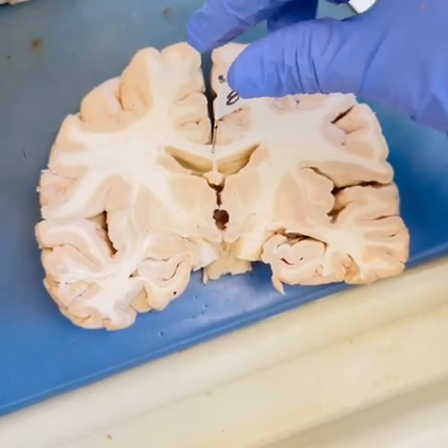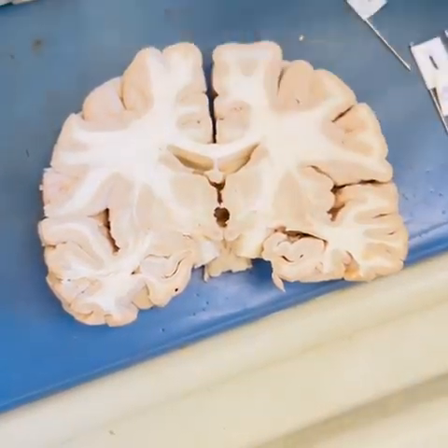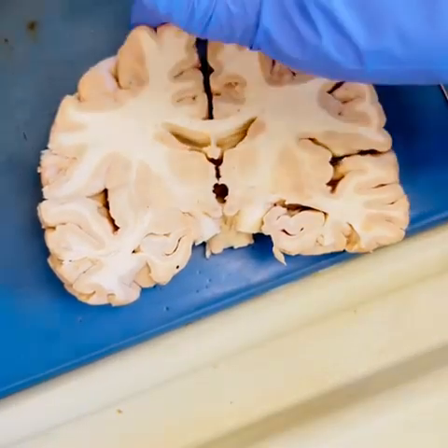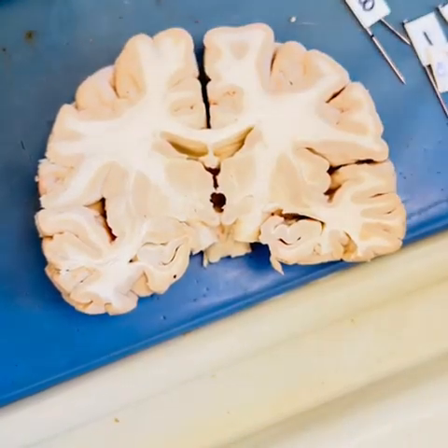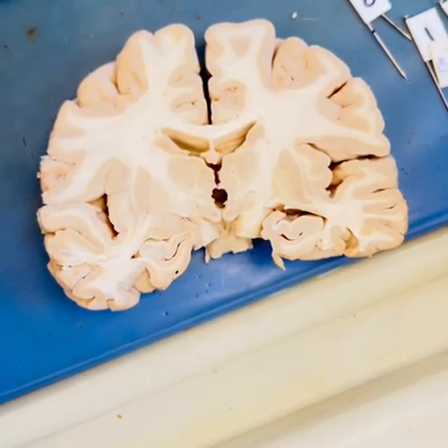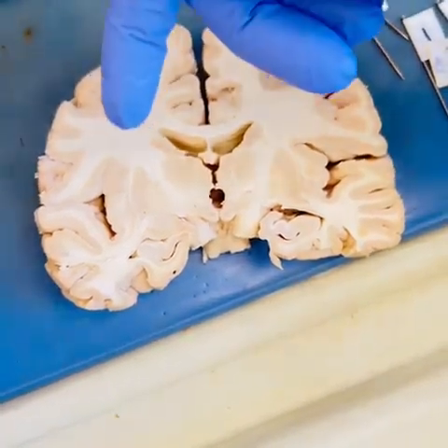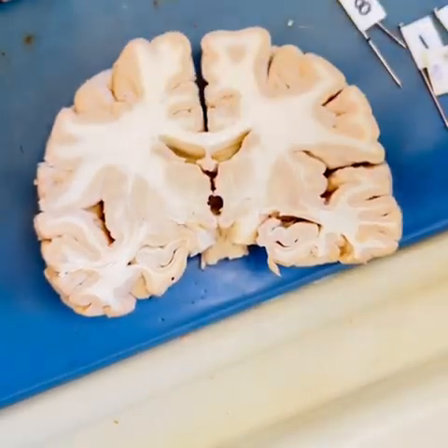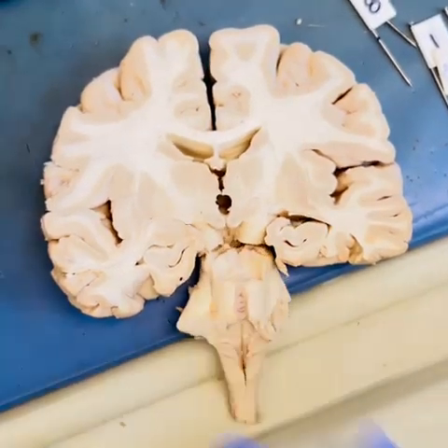And finally, eight is the corpus callosum, which connects the right and left hemispheres. Although it is debated, it is believed that the right and left hemispheres are different in their functions, with the right hemisphere being the more creative side and the left hemisphere being the more analytical or logical side. It is fact, however, that the left hemisphere controls the right side of our body and the right hemisphere controls the left side. And that crossover actually occurs in the brainstem.